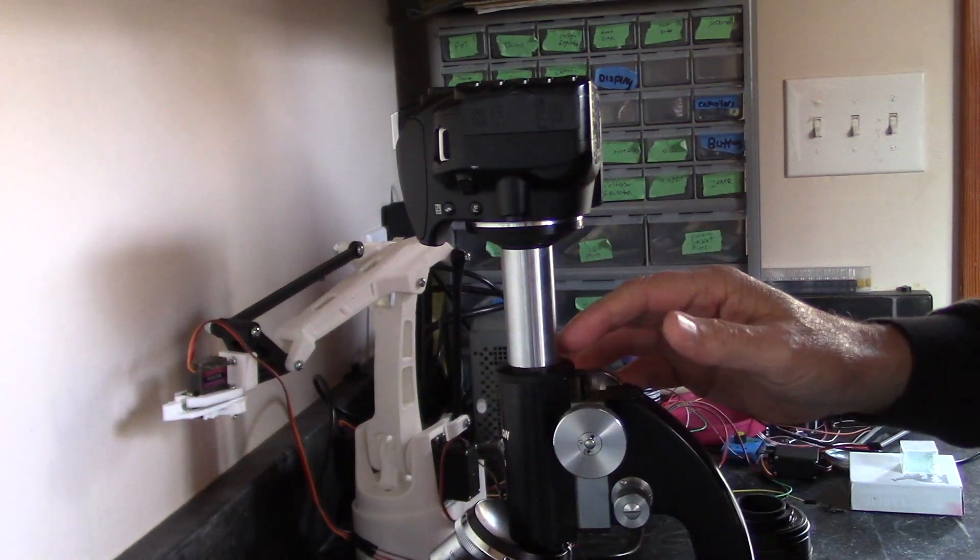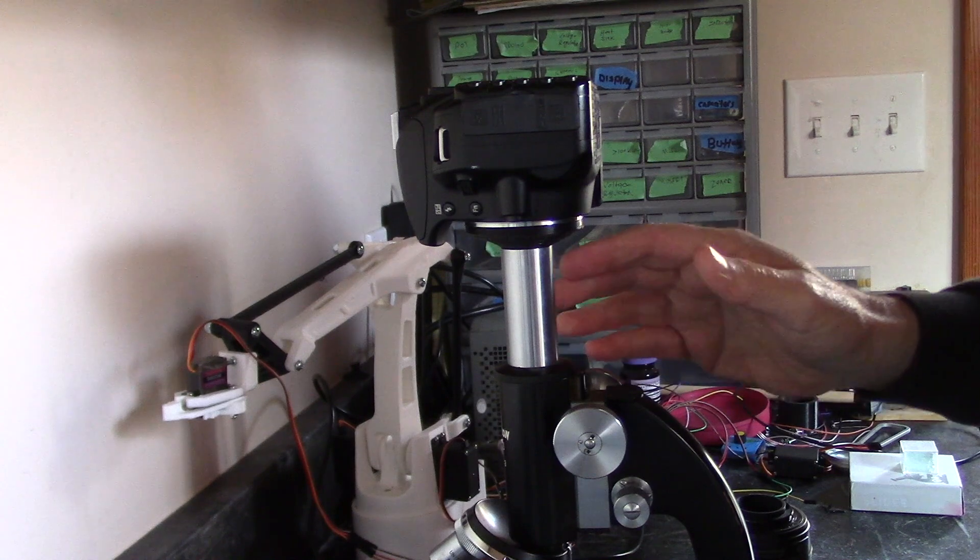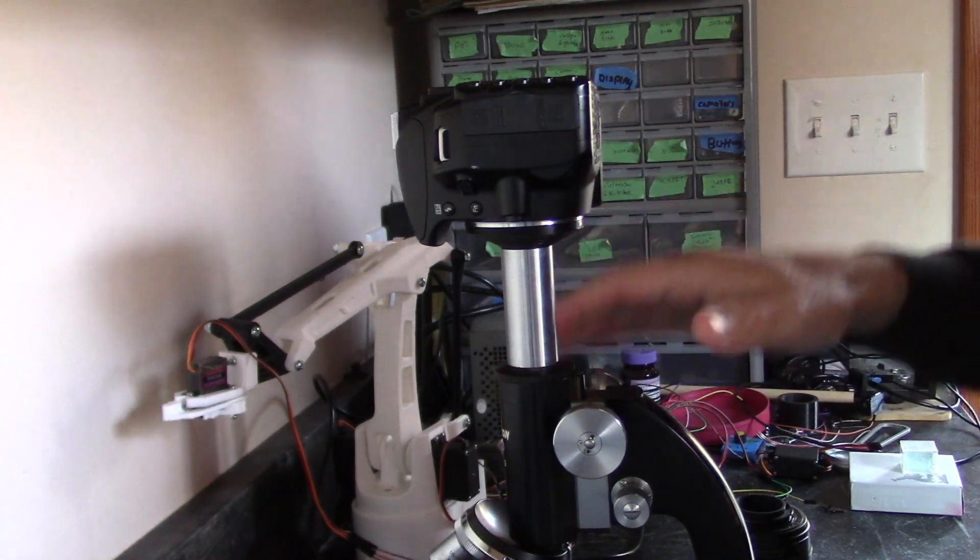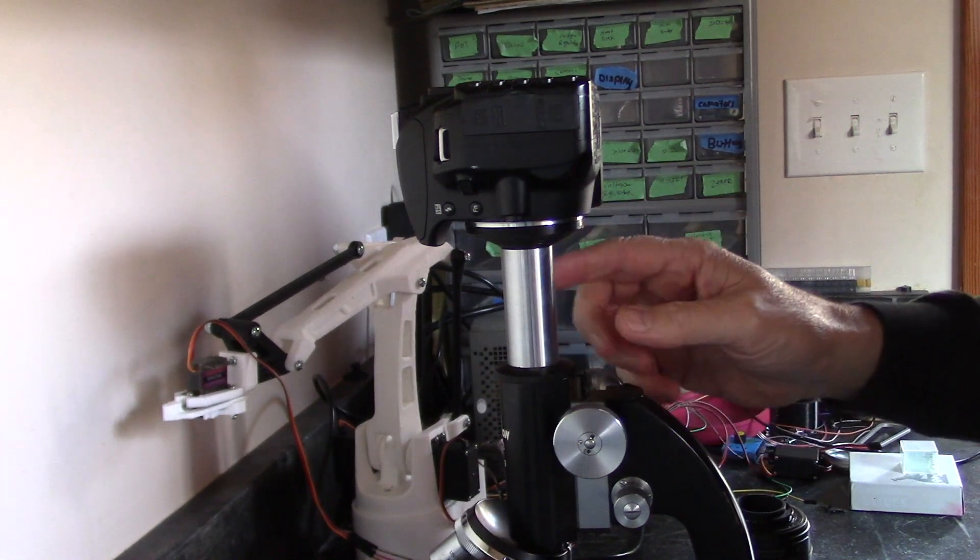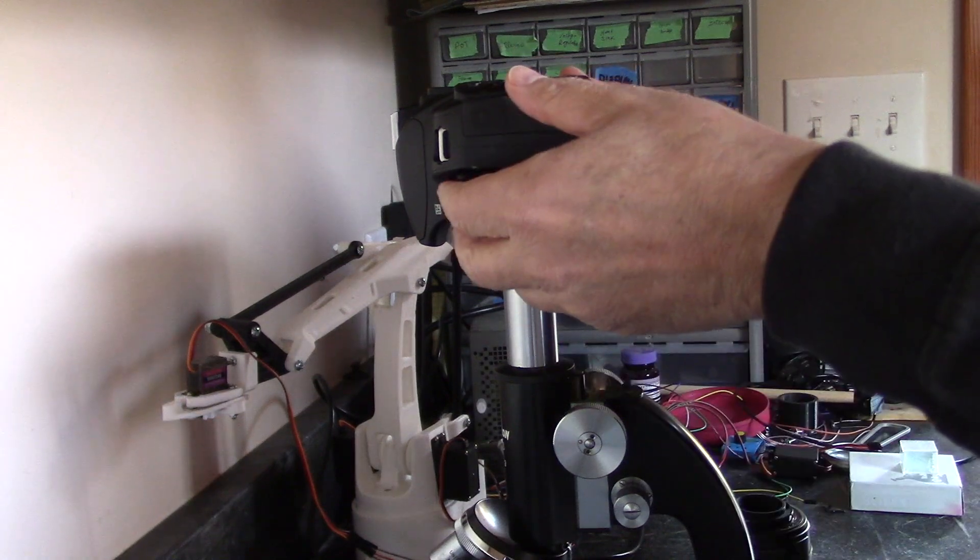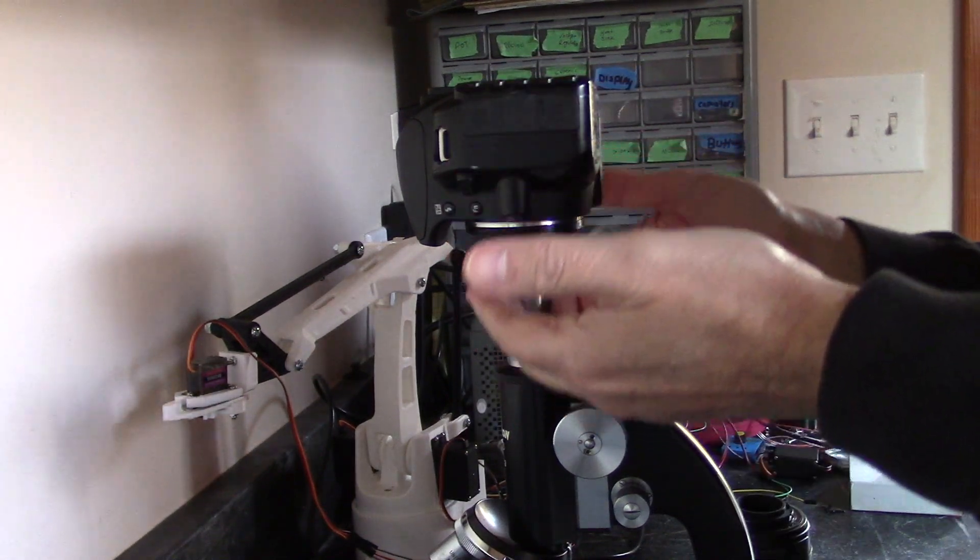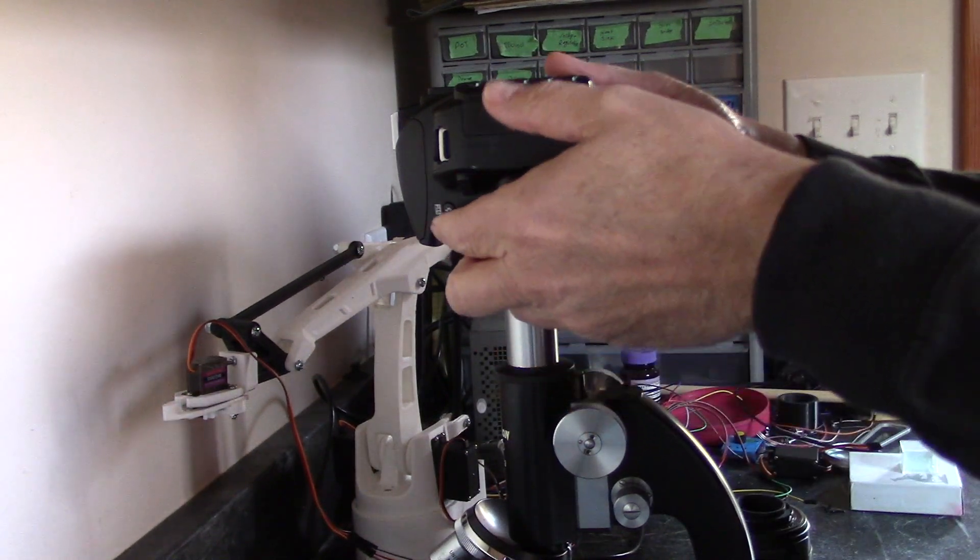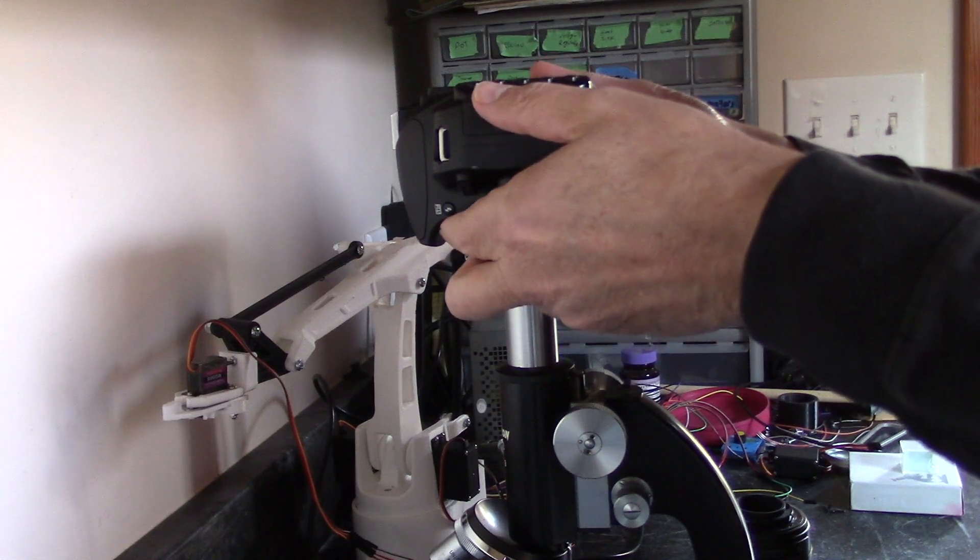Well, what I have here with this particular setup is that I can never bring this down in focus at this point, even though it fits that tube nice and neat. And I was really happy with that. So it'll never come in focus.